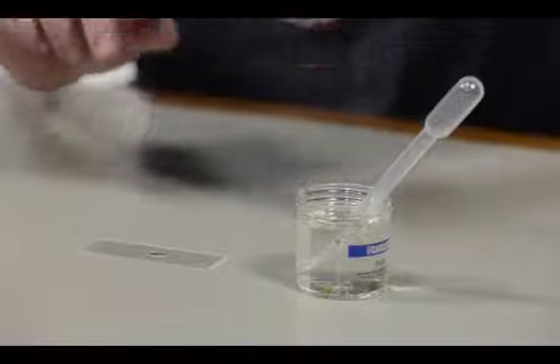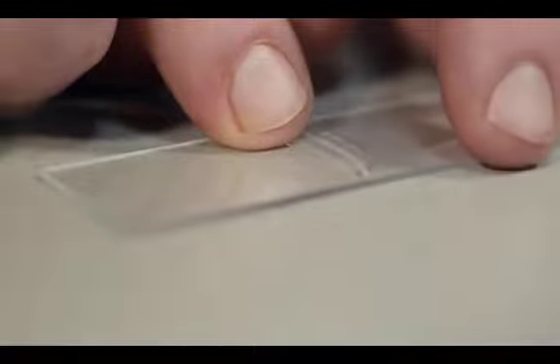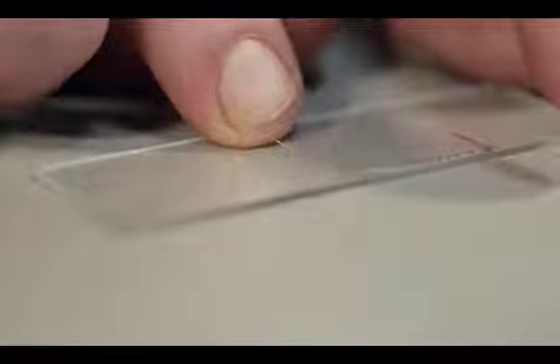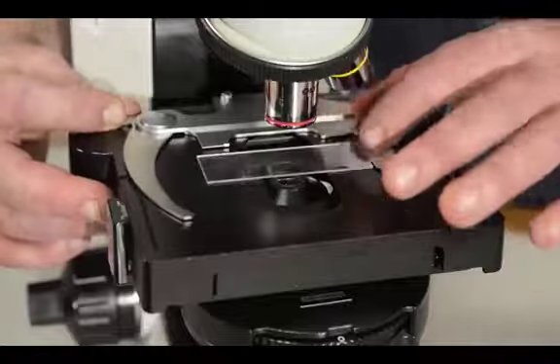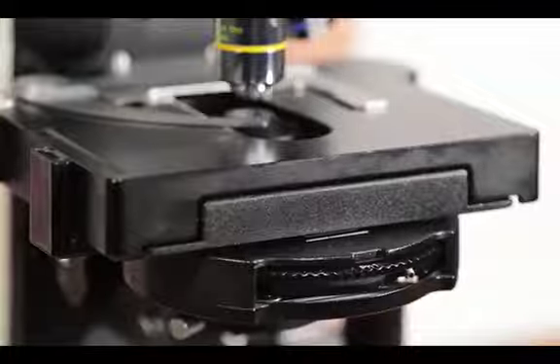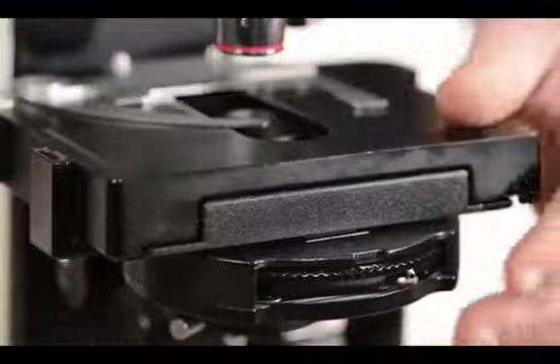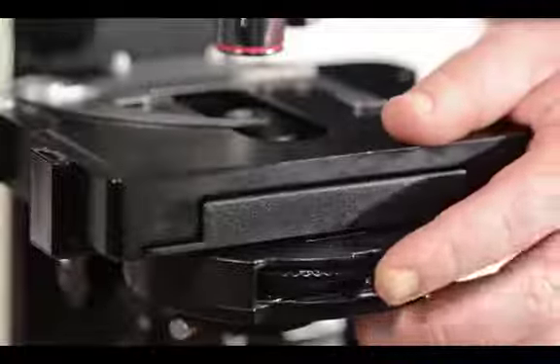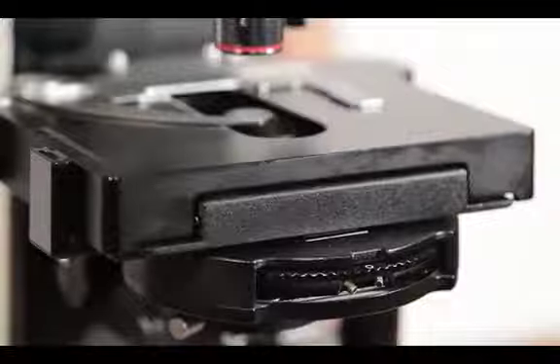Add a drop taken from the bottom of the sample jar to your slide. Add the cover slip at an angle and then drop it. If you set up your slide this way, you will minimize air bubbles. Place the slide on top of the stage between the stage clip and you are ready to begin. Make sure your objective is set on the lowest power and that the filter wheel is set to 0, which stands for bright field. You should also move the condenser down about half a turn to prevent bumping against the slide.